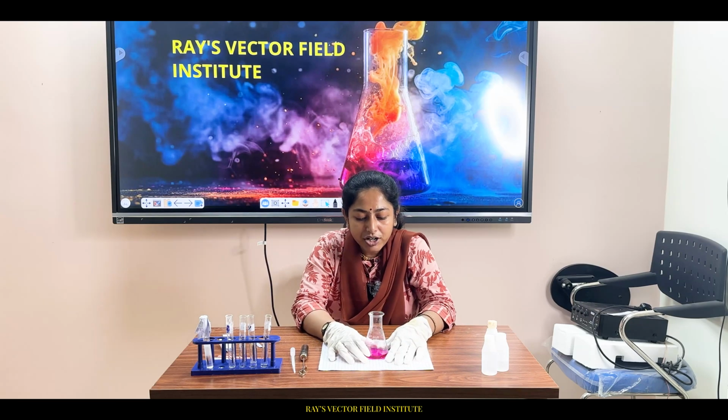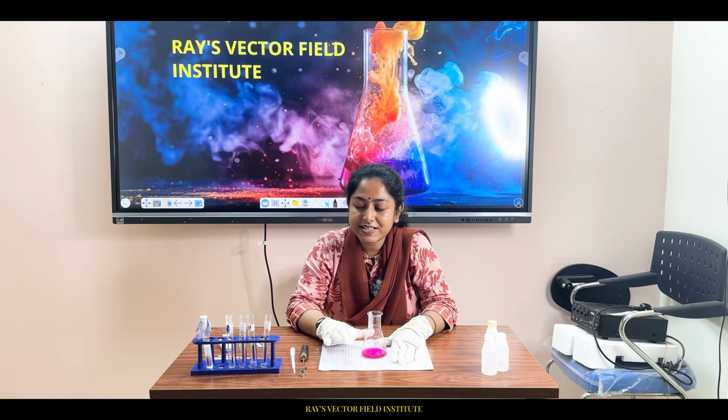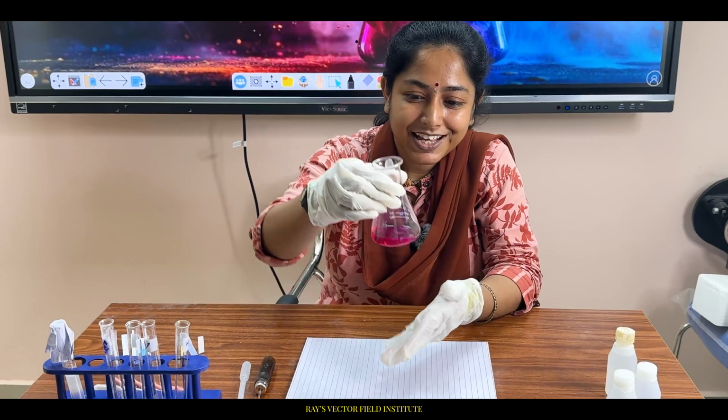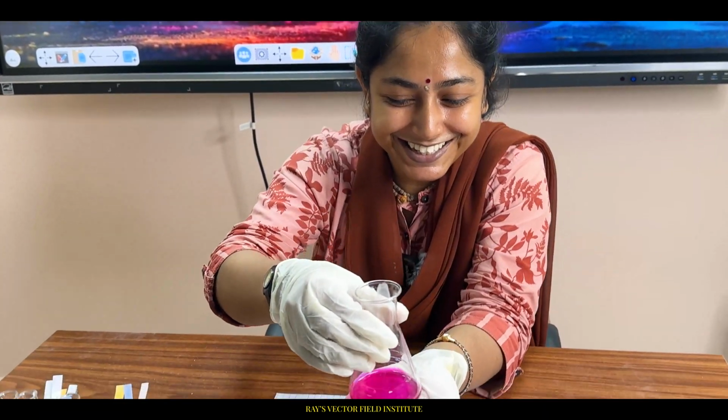So from this, what can you infer? This is the end of this experiment. Now we will be discussing this chemical reaction in a little bit of detail. Come, see the color. It's beautiful, isn't it?